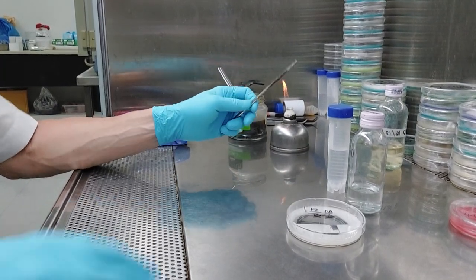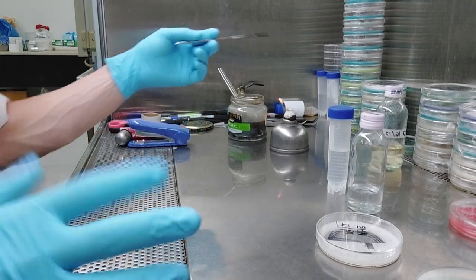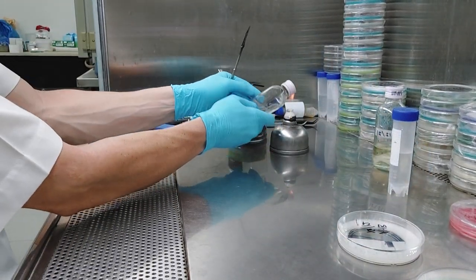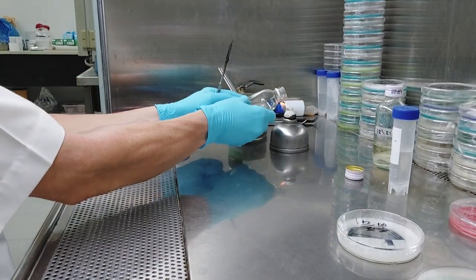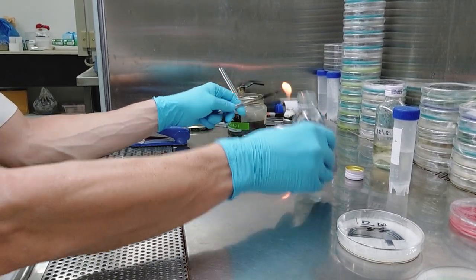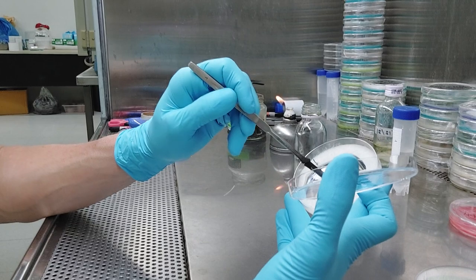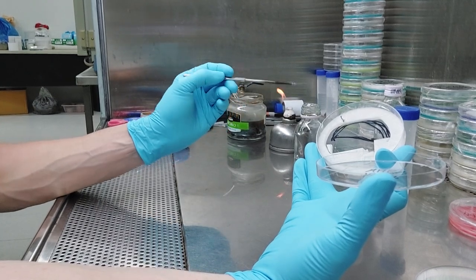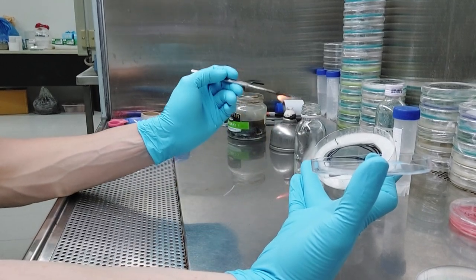To be honest, the way the world's working these days, five or six years old, that culture, that'll be old news, right? Well, moved on. Maybe to some of my pathogens. So here's the cool thing about jars that have, I should say, containers that have metal lids and glass lips. You can flame the hell out of them. So really, literally burn the hell out of them. So if you're working at an SAB, and you're a little bit more worried about airflow, if I flame this, and that remains warm for a few seconds, that gives me some time. So I'm going to come back here, cut strips. This is not hard, you guys. See how I've done that? Pick them up one by one. Get them in there again. I kind of got some on the lip there. That'll be okay.